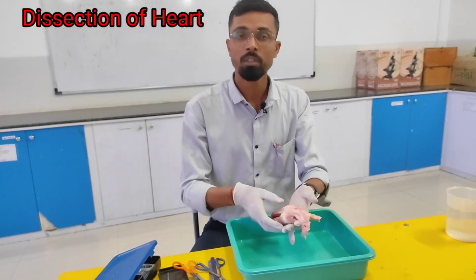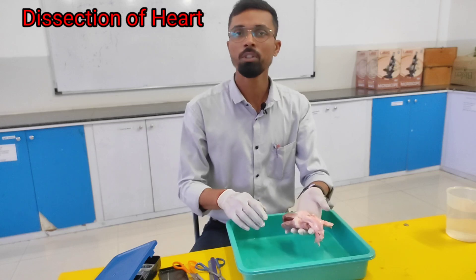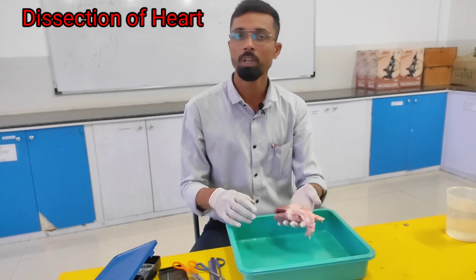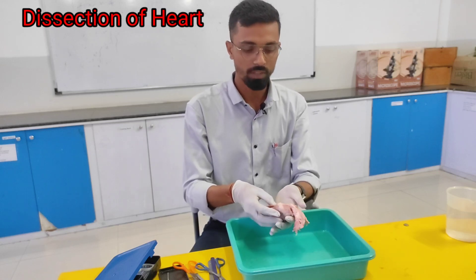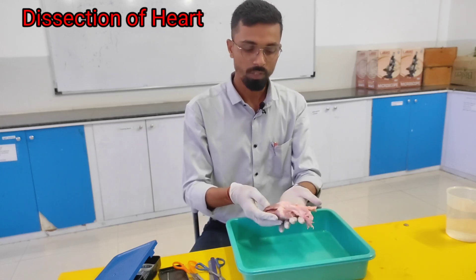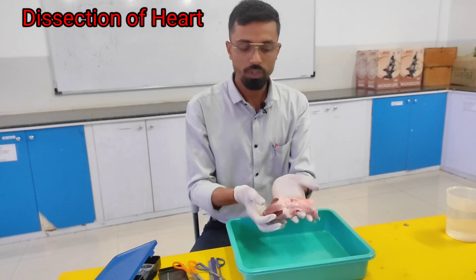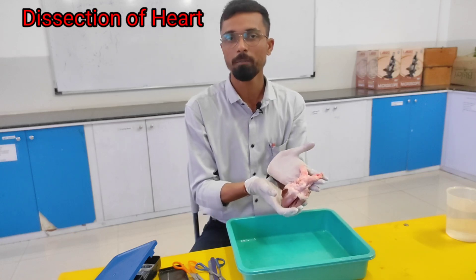Good morning, students. In this video, we will see about a heart — that is a goat heart. We will see the proper structure of a goat heart.